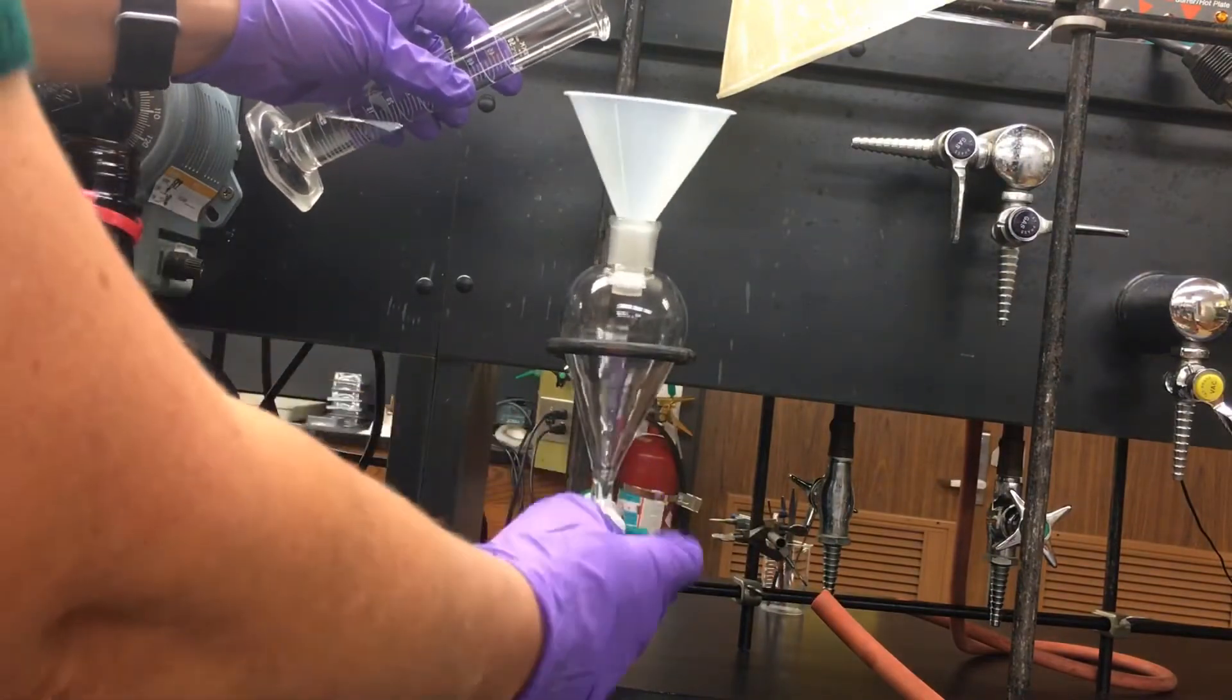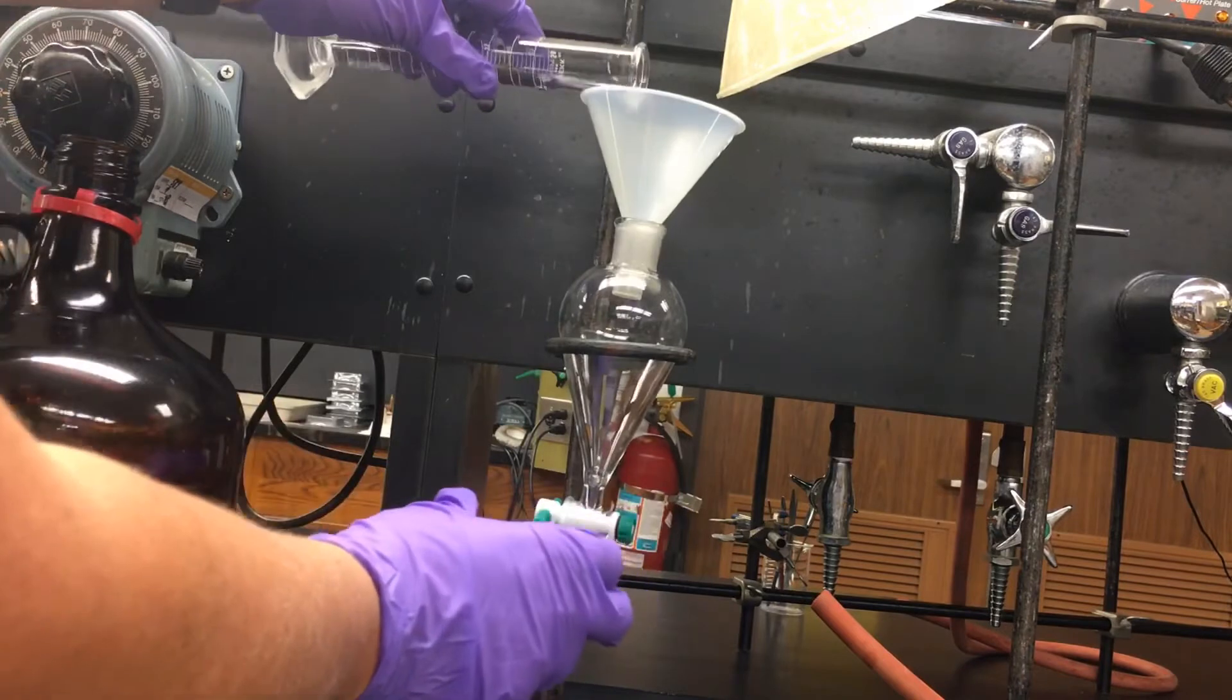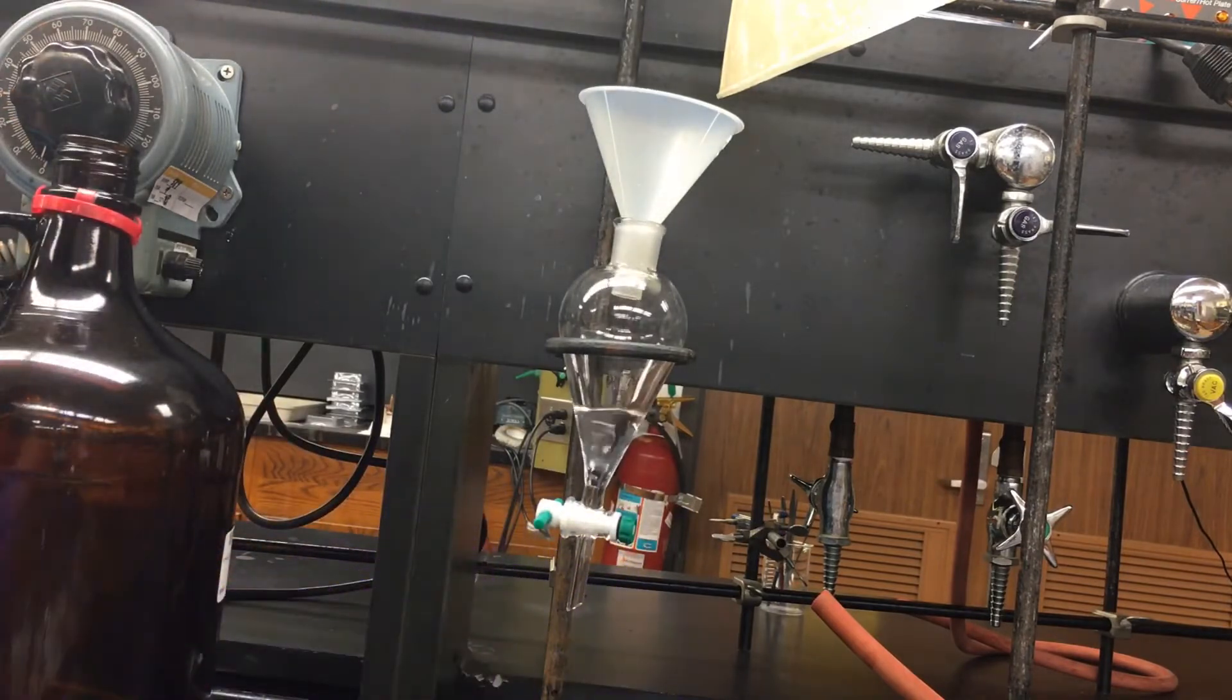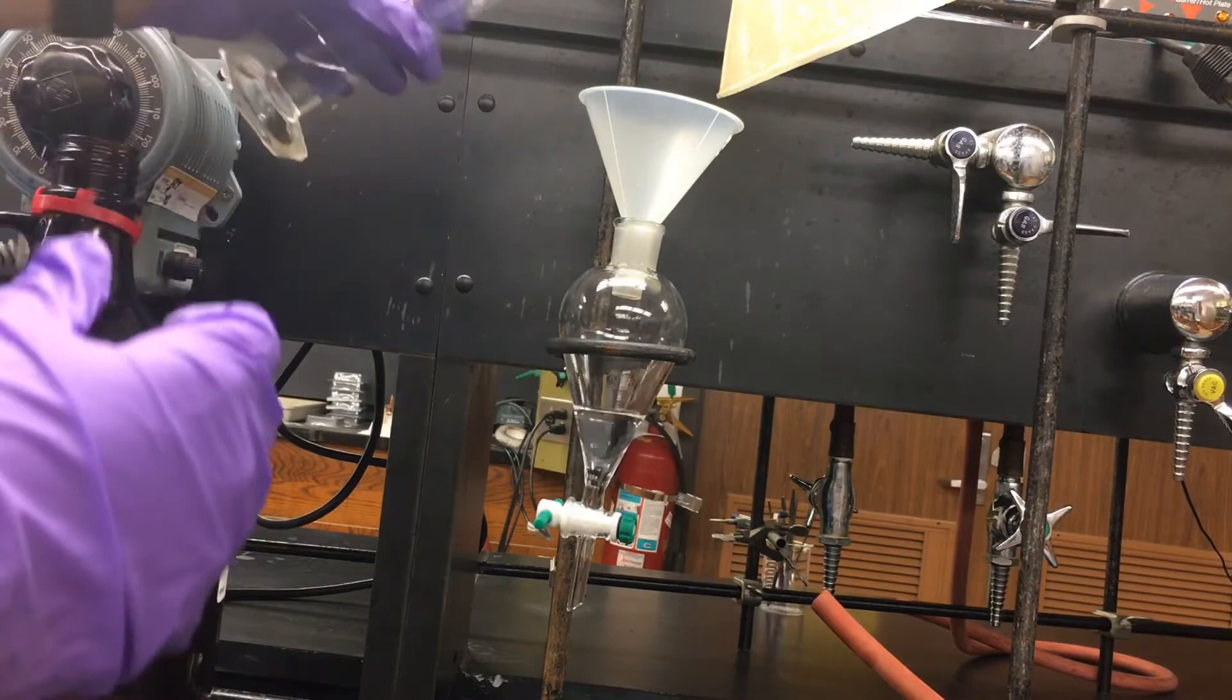I'm making sure that the stopcock is closed. It is perpendicular to the stem of the funnel to indicate that it's closed.